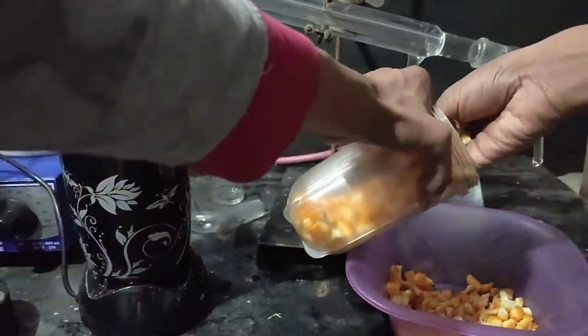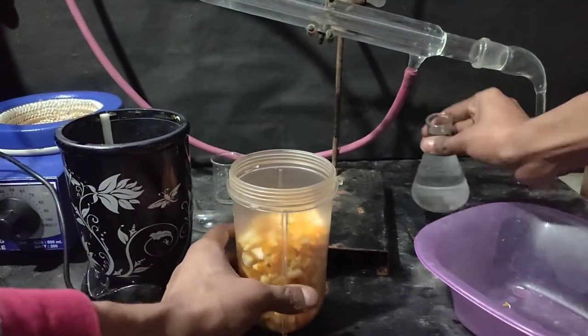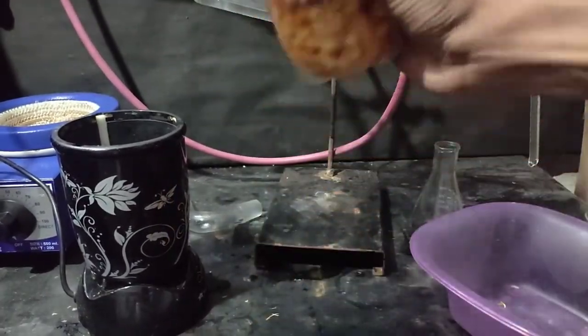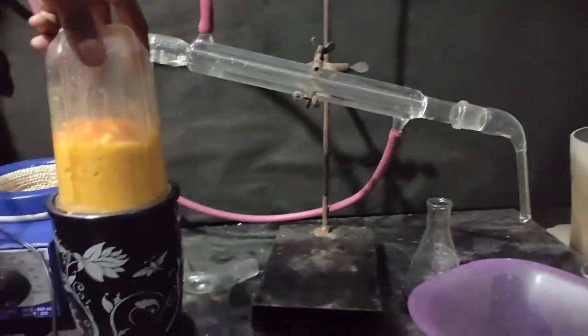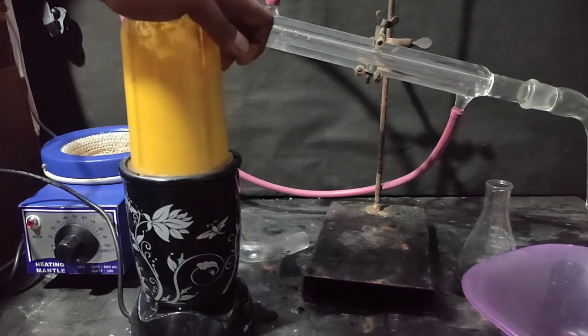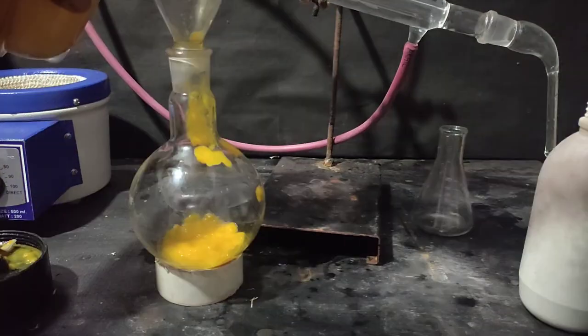What should I do now? So I transferred the leftover peels into my blender and then I blended them using some distillate that came in the previous run and made a paste out of it. Then I transferred this paste into my 500ml round bottom flask.